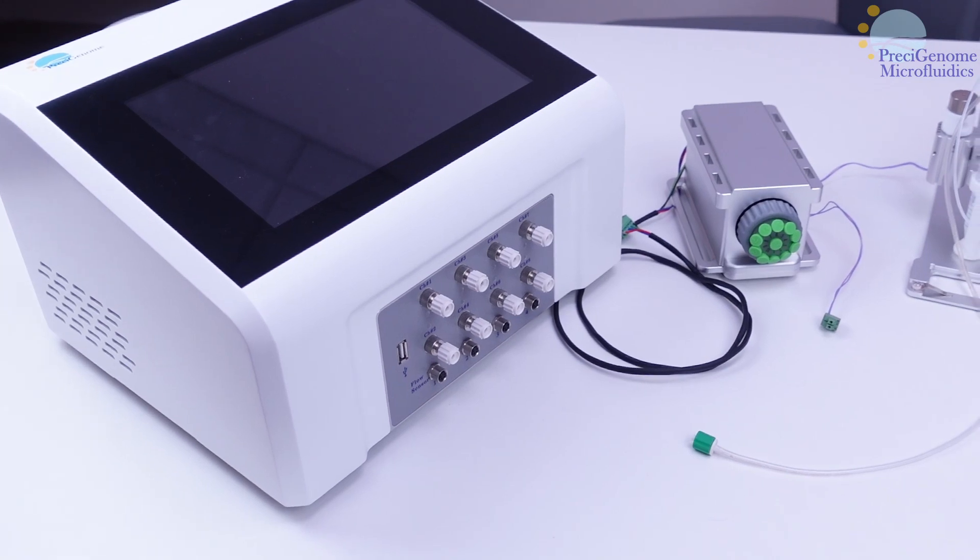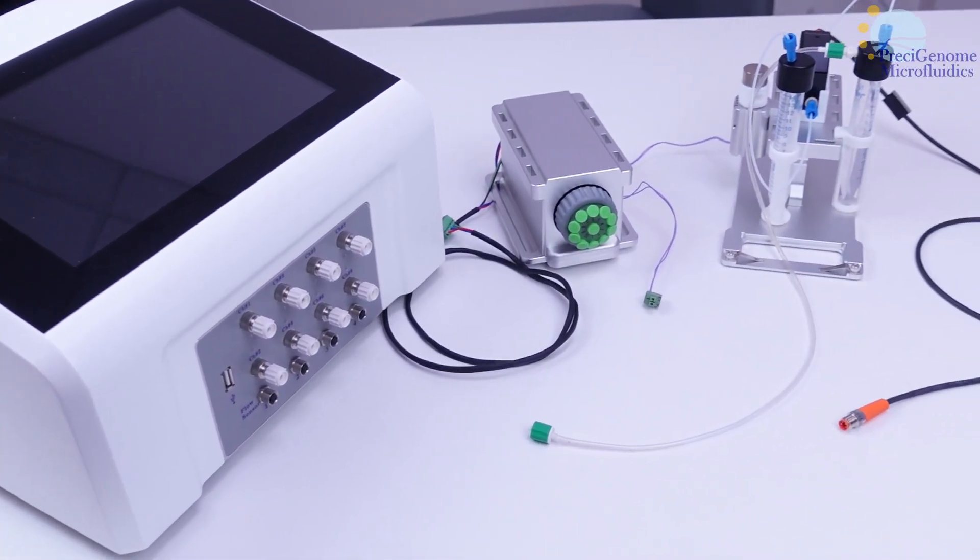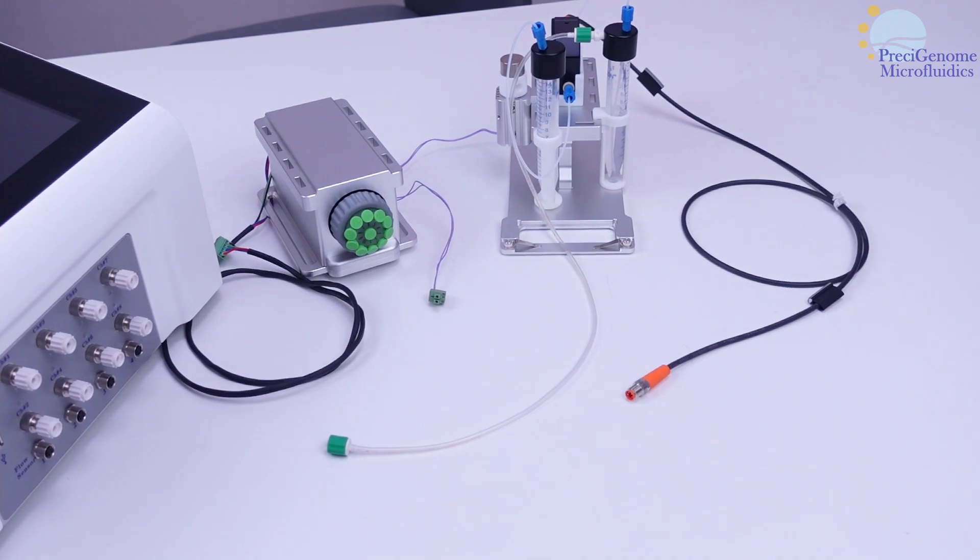In this video, we will show how to connect an iFlowTouch pressure controller to common components of an experimental setup.